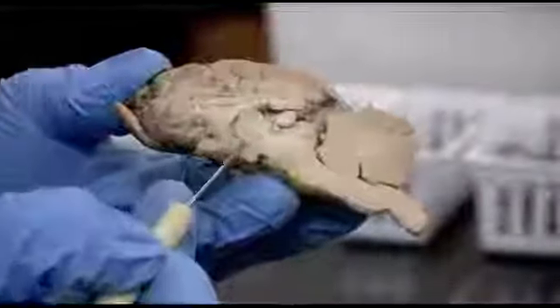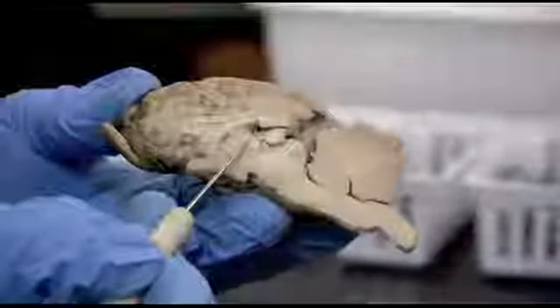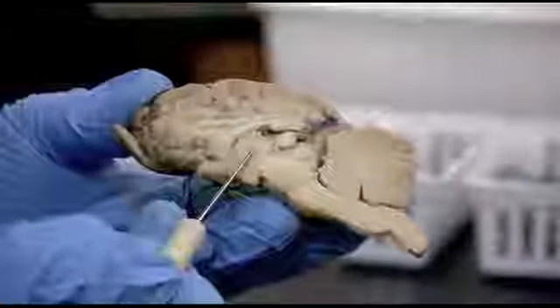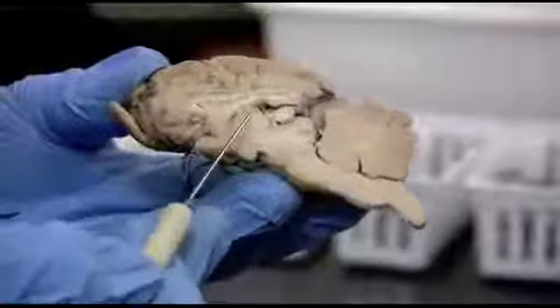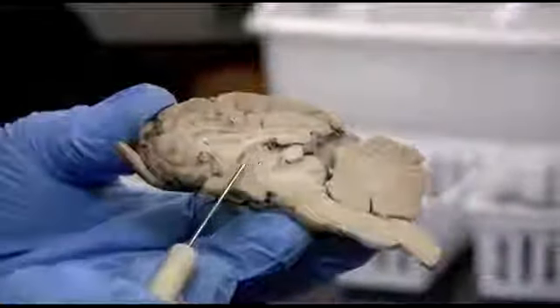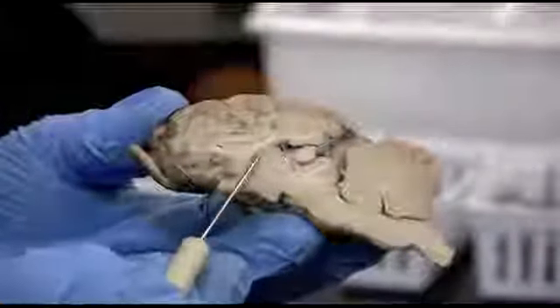And remember that thalamus, for our purposes, we're just remembering that it is right in the middle of the brain. It's the relay center, so all the sensory information that's coming in from all these different nerves and locations is going to end up going through the thalamus, where there are different nuclei responsible for each different region.